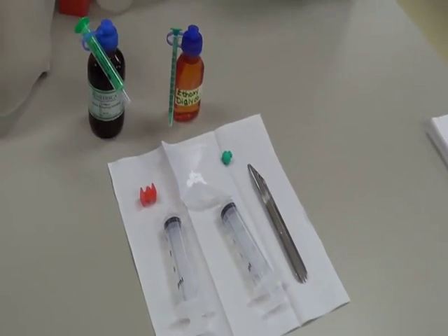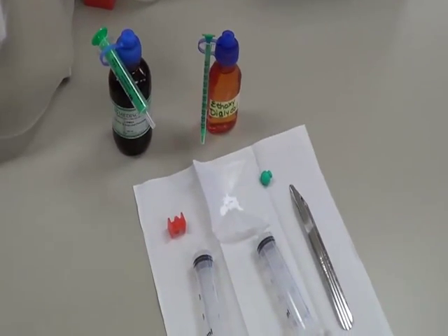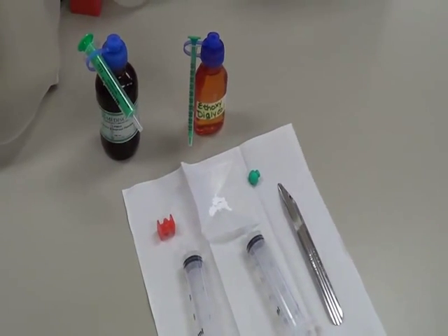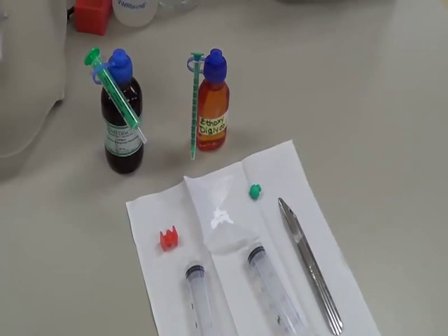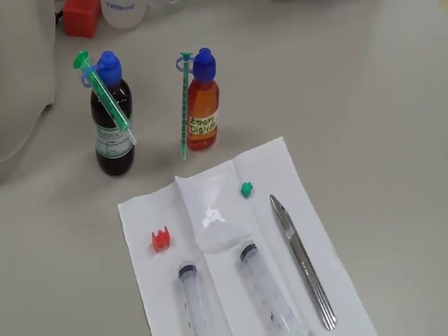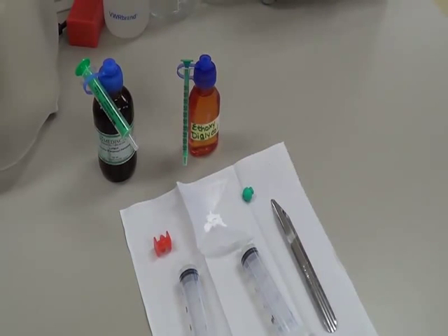Ethoxidiglycol is a solvent basically. And the last one is the Poloxamer which is in the refrigerator right now. The reason we have to keep that Poloxamer in the refrigerator is at room temperature it will be a semi-solid.